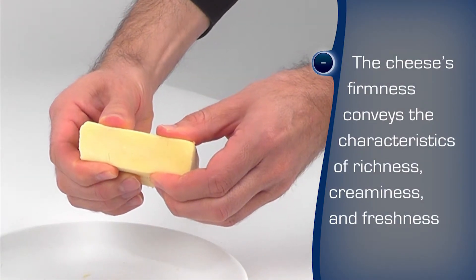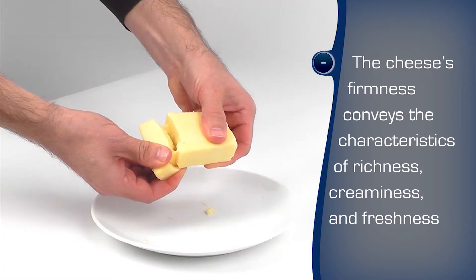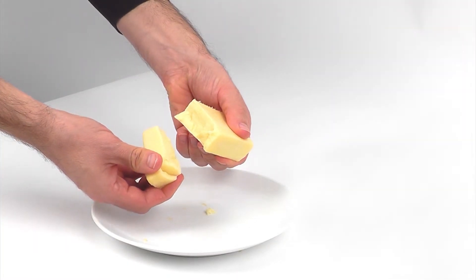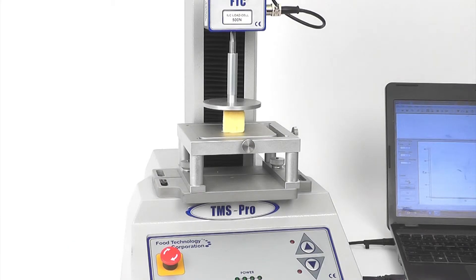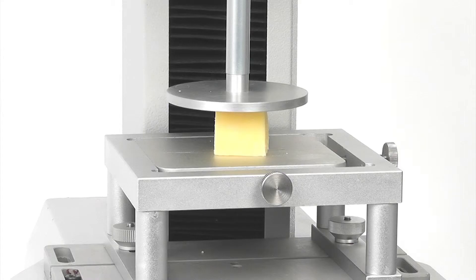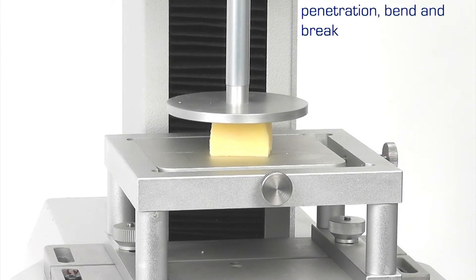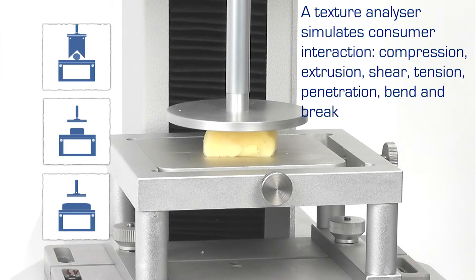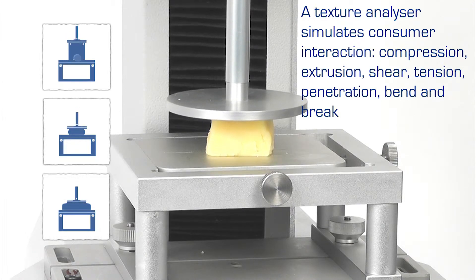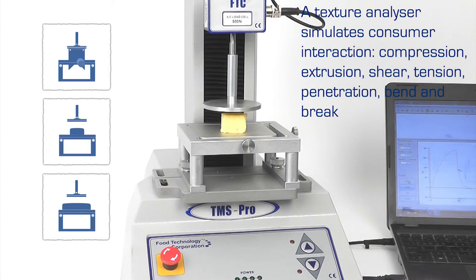For a hard cheese, the firmness and the way the cheese yields are important factors in conveying the richness. A texture analyzer enables the measurement of attributes which reflect the customer's experience by simulating the interaction: compression, extrusion, shear, tension, penetration, bend and break.